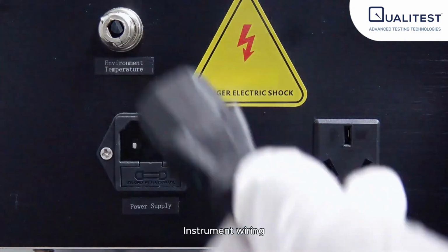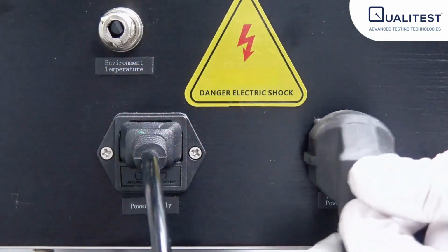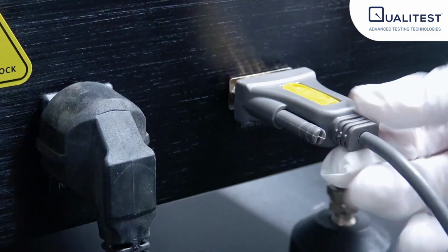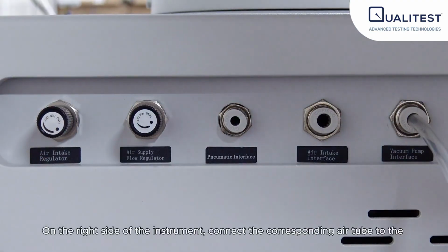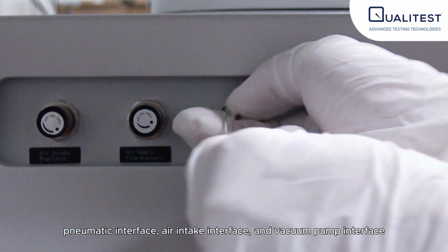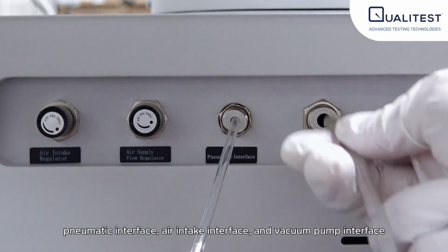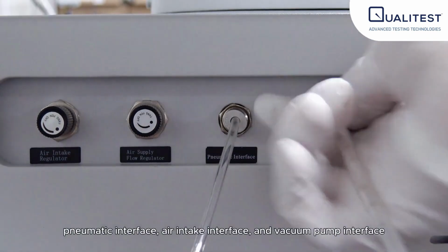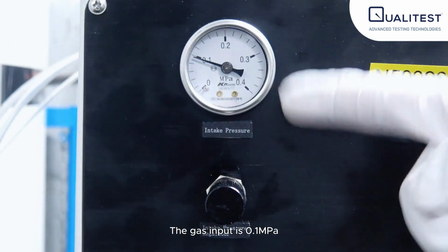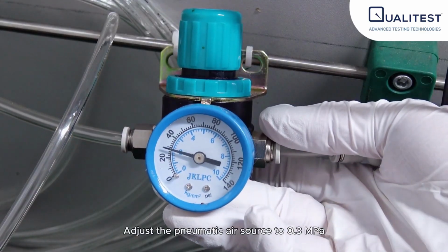Instrument wiring. On the right side of the instrument, connect the corresponding air tube to the pneumatic interface, air intake interface, and vacuum pump interface. The gas input is 0.1 megapascal. Adjust the pneumatic air source to 0.3 megapascal.